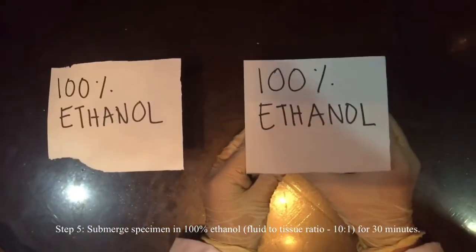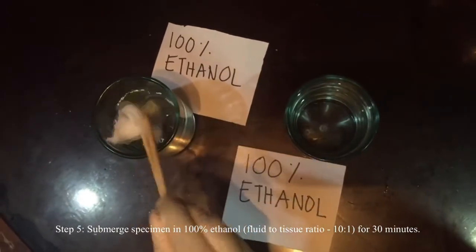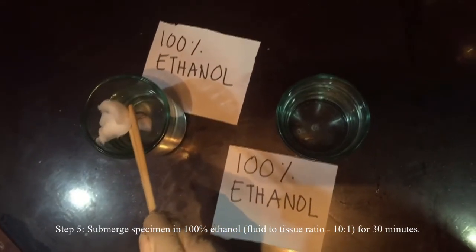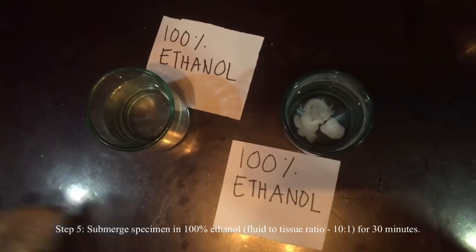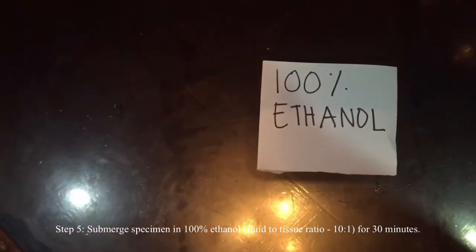So after waiting 15 minutes, we now proceed to our step 5. Step 5 is our third change of the 100% ethanol or our absolute ethanol. So now we submerge this tissue in this third change for another 30 minutes.